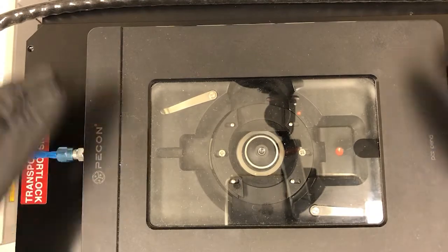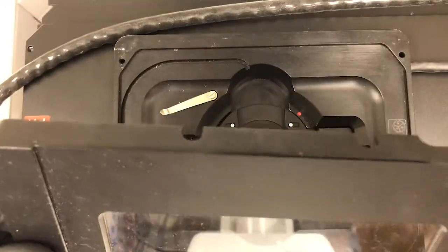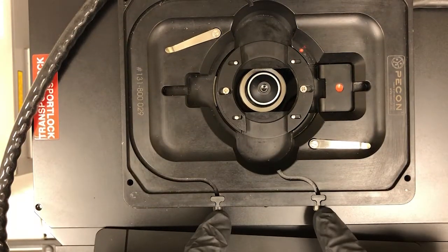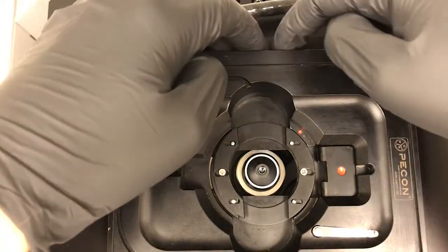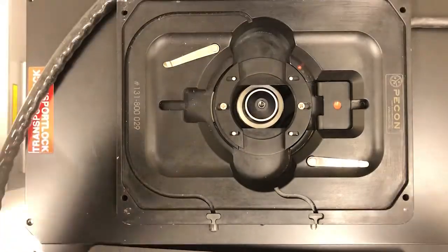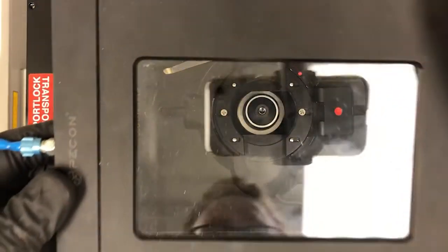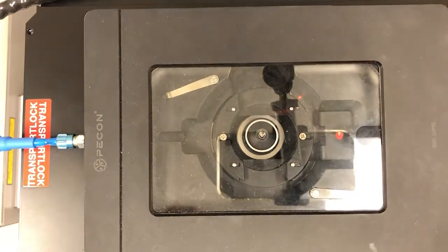So to reiterate, we need to put the lid on. The lid has, if you can see here, these notches, and those notches go into little pegs on both sides of this. Well, you can't see them there. Actually, it doesn't have any there, excuse me. It just has two pegs on this side, meaning you can put the lid like this or at 180 degrees. So let's put that there. So that's what it looks like when it's ready to go.